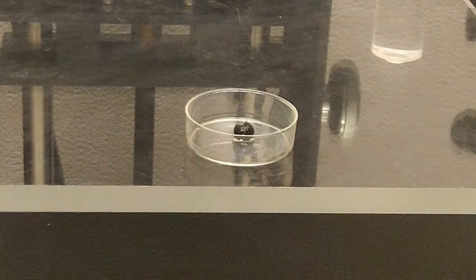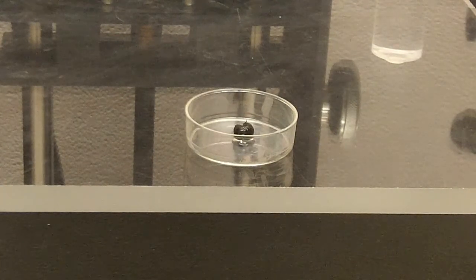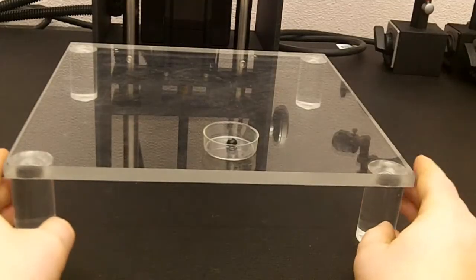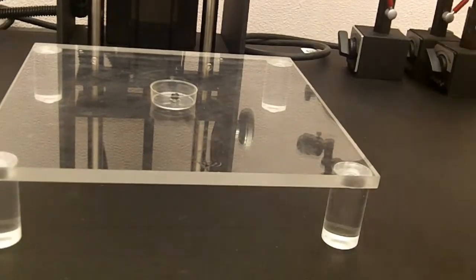And then fill it up with ethanol, and it's the same process as you would with the sand technique. Here I have the base that I put specimens on. It's under the camera and the lift.